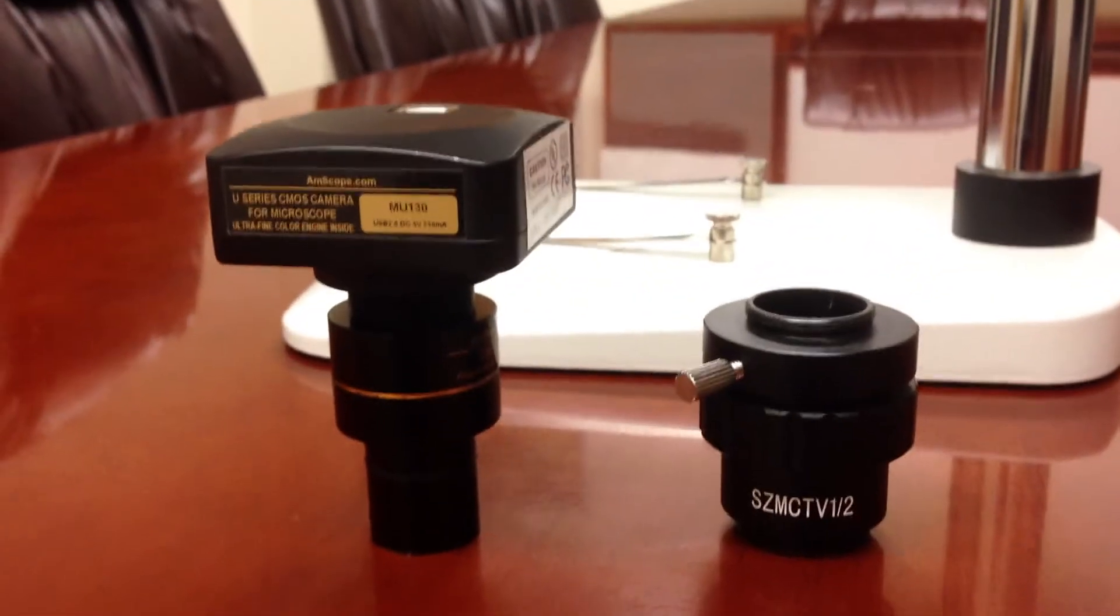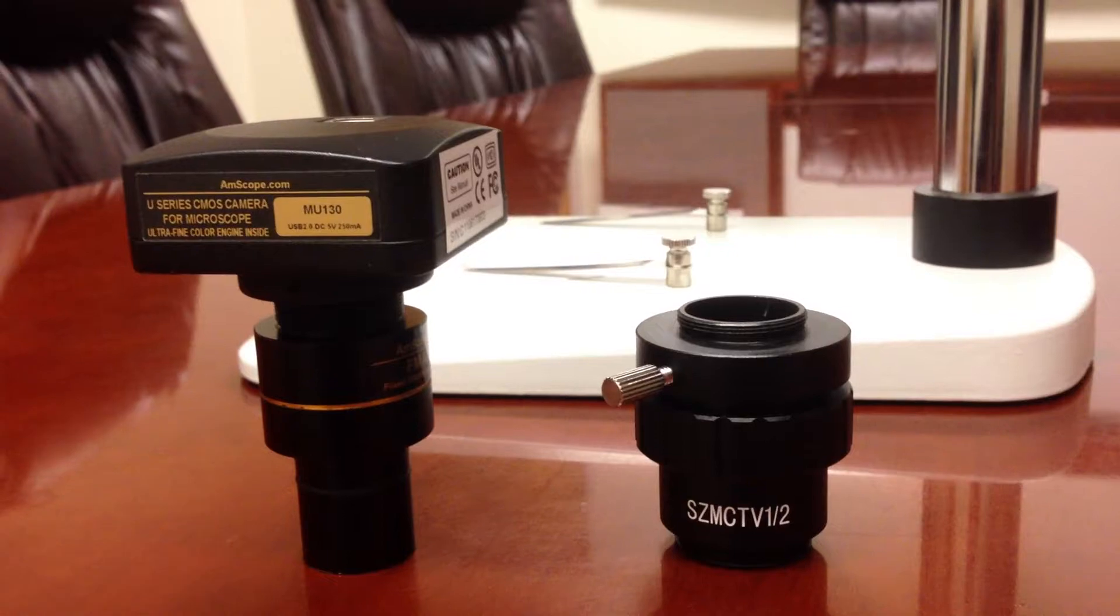Okay, so this video is going to teach you how to mount the adapter for the camera correctly.